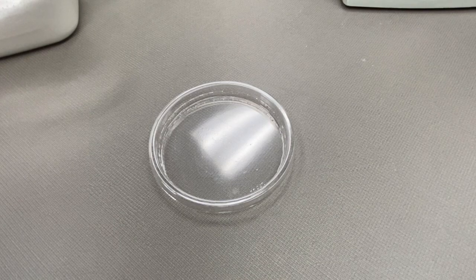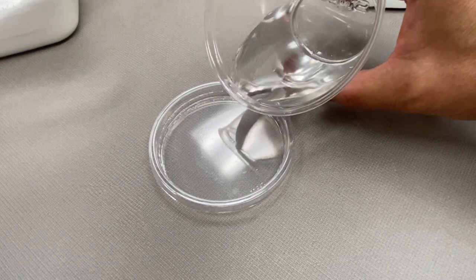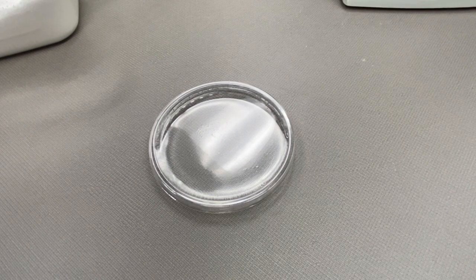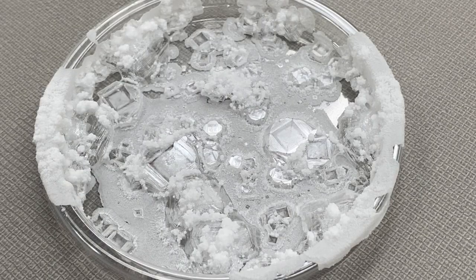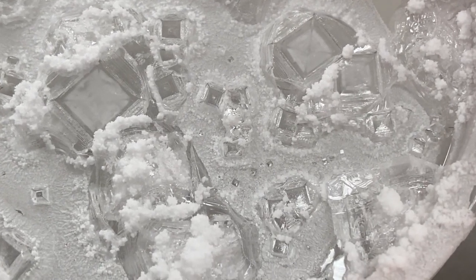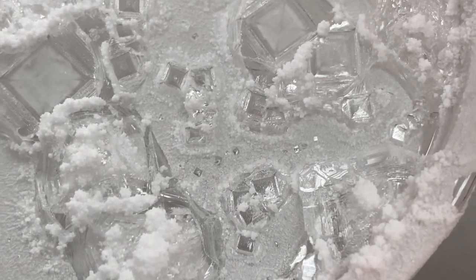Another way to find out where the salt goes when a solution is made is by evaporating the solution. If we evaporate the water and there is salt in the solution, the salt should be left behind when the water is gone. So I poured the salt solution into our evaporation dish and let the water evaporate out. After a few days, this is what is left. Once the water has evaporated, the salt is in the form of a crystal. We can identify the type of crystal by its properties such as shape, color, and pattern. A salt crystal is square with an x from corner to corner.